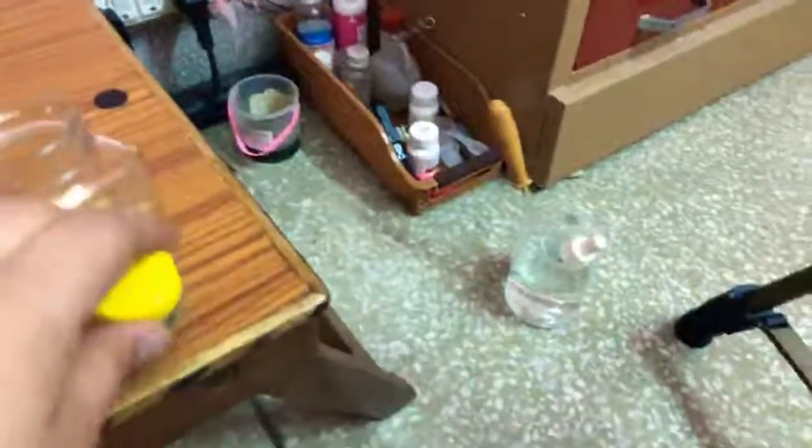Okay, I was just showing that I am preparing another. Where is it? I'm preparing another culture, which will probably have some amoeba in a few days from now. This is one, and there are two more sets which I'm preparing. Here is one algae, the sea algae, which is still being observed, and this is another.